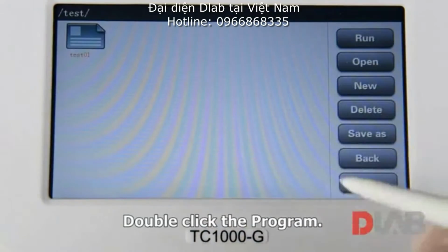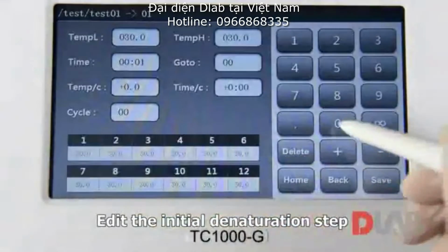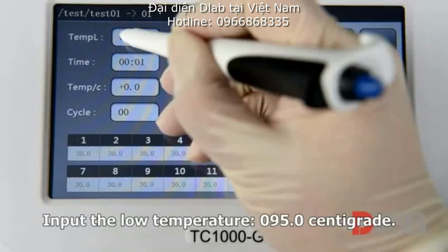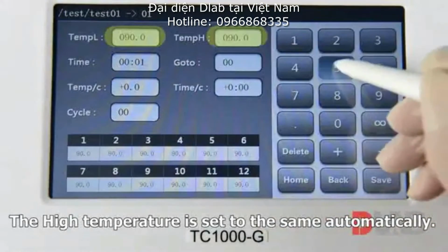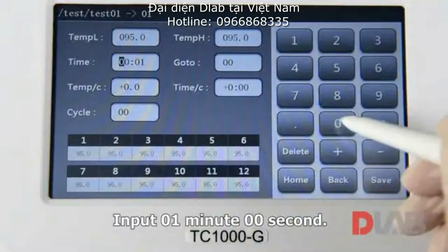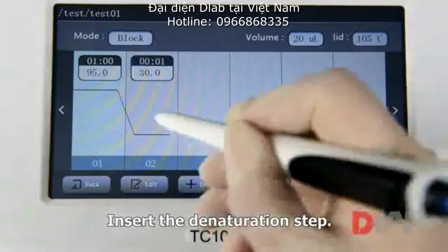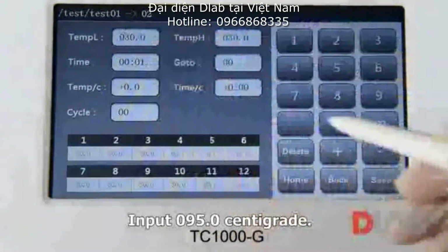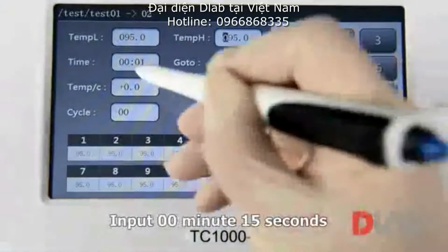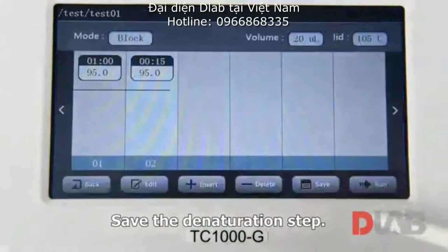Double-click the program. Edit the initial denaturation step. Input the low temperature. The high temperature is set to the same automatically. Input 1 minute. Insert the denaturation step. Input 95 centigrade. Input 15 seconds. Save the denaturation step.